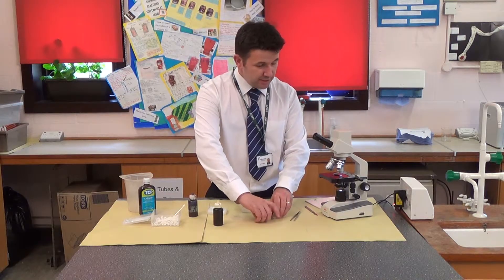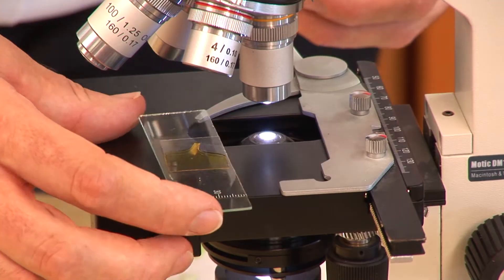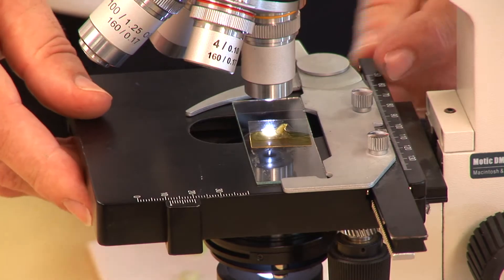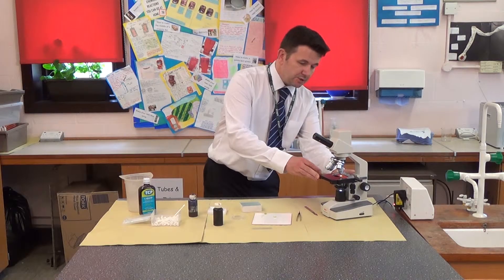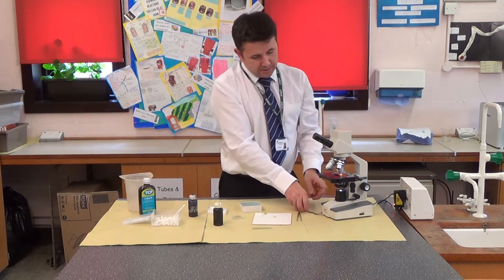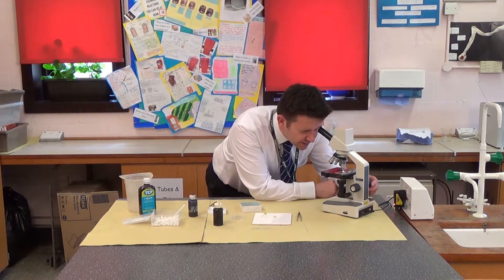Now I'm going to place it onto the microscope stage. Before I do that, I'm just going to lower the microscope stage down and then place it onto the microscope, like so. I'm just going to adjust it. What you've got to do before you focus the microscope is make sure the stage is quite high up to the lens — so that's as high as it will go. Then you're going to focus downwards, so just put your eye to the eyepiece and focus downwards until you get an image.